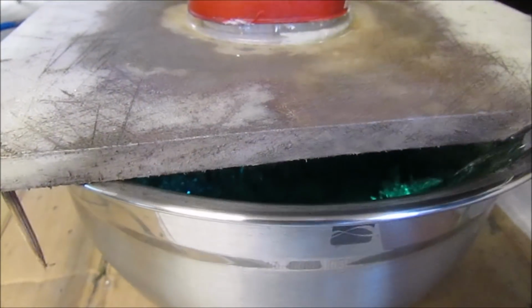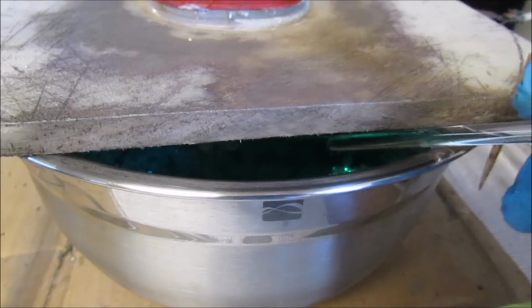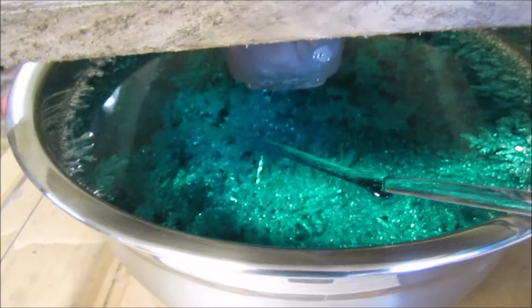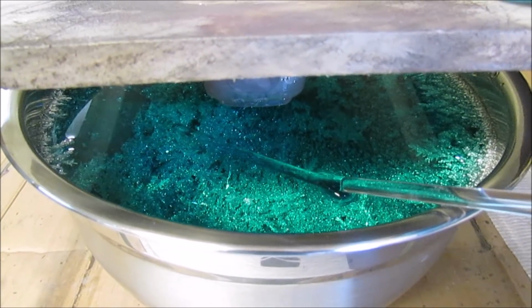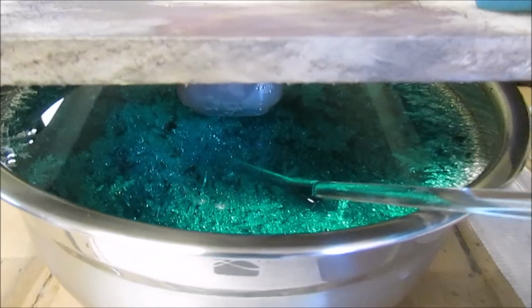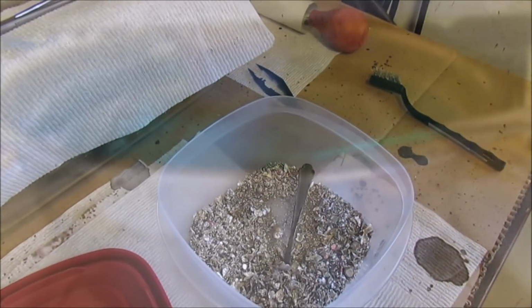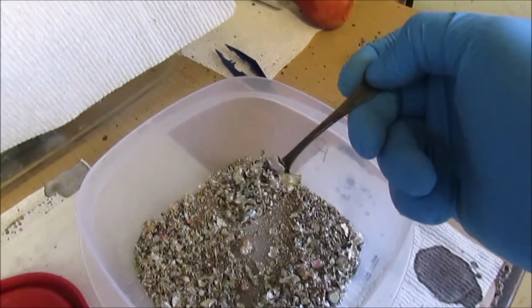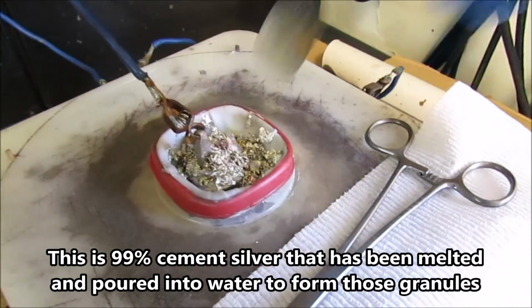because if they contact that anode basket, it'll cause a short circuit through the cell and burn a hole through the anode filter and then contaminate my batch of silver. I have to run it back through the cell a second time. This is the impure silver. I'm going to go ahead and refill the anode basket here with some more impure silver.